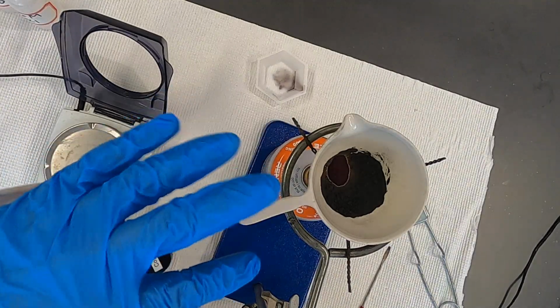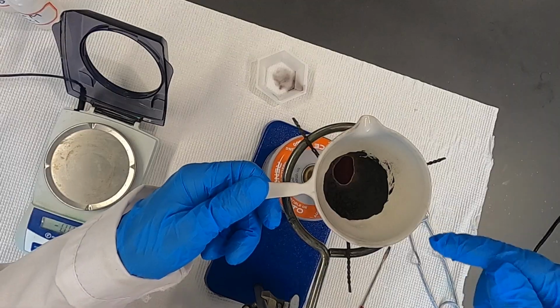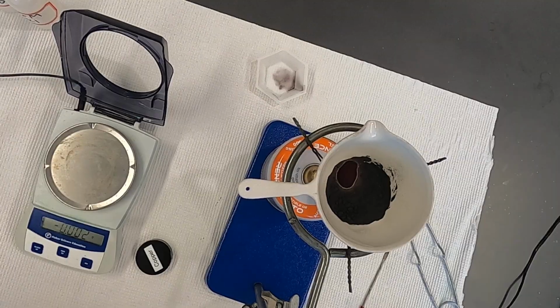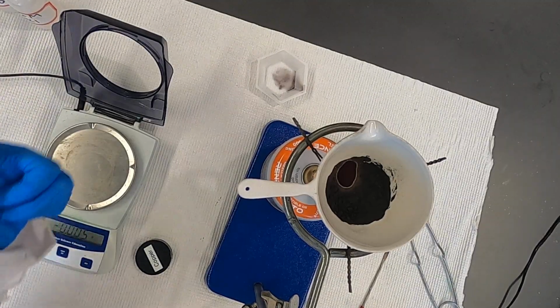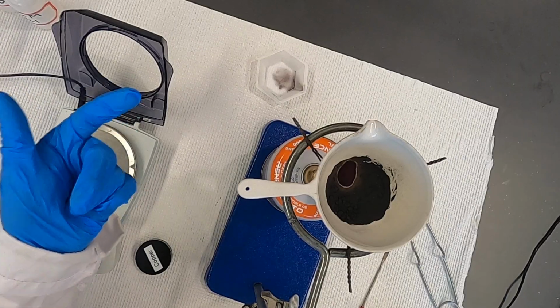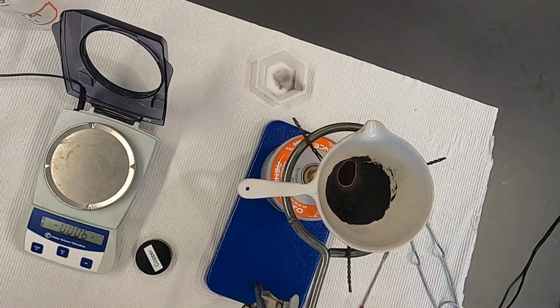Now, what you would do is, instead of adding the copper into it, you would want to take the mass of the copper oxide alone and record that. And that's going to be what you'll use to derive the empirical formula of the copper oxide. So you will have had the mass of the crucible plus copper. Then we went ahead and hit it with flame, and you'll get the mass of the crucible plus the copper oxide. From that, you can go ahead and work through the laboratory and derive that empirical formula.